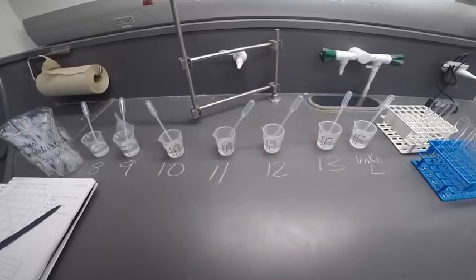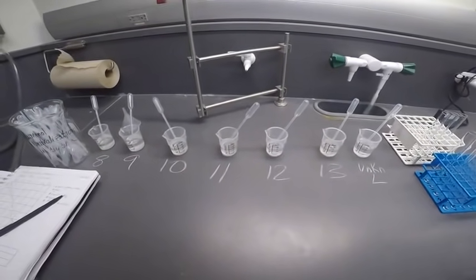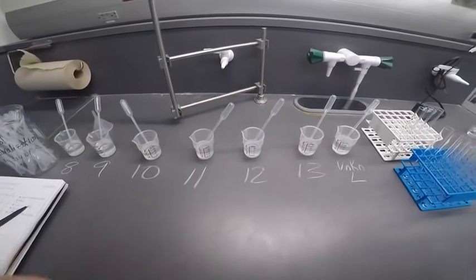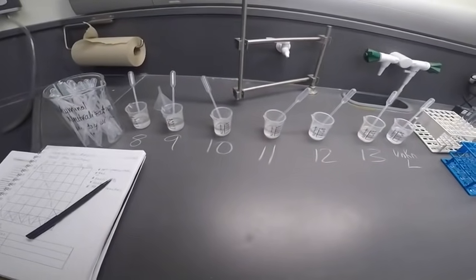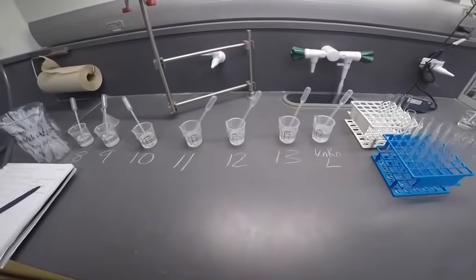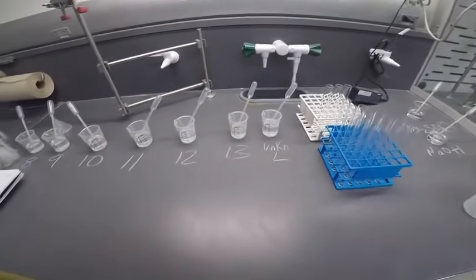Alright guys, this is experiment 12 for Chem 110. We're going to do qualitative analysis. Probably one of my favorite labs of this term, and a lot of other people who've taught this lab before feel the same way. You get to combine a lot of what you've learned from previous labs to complete this one. So there are two main parts of this lab.